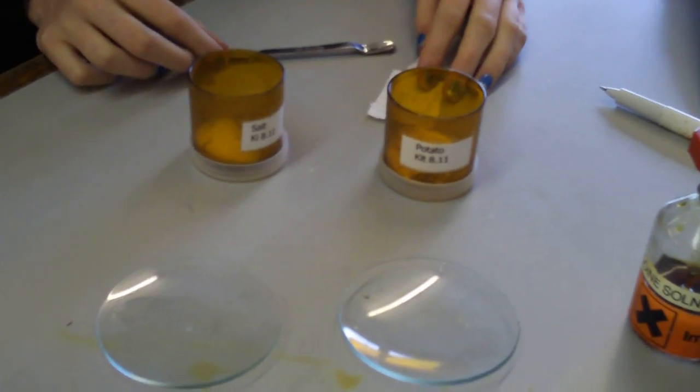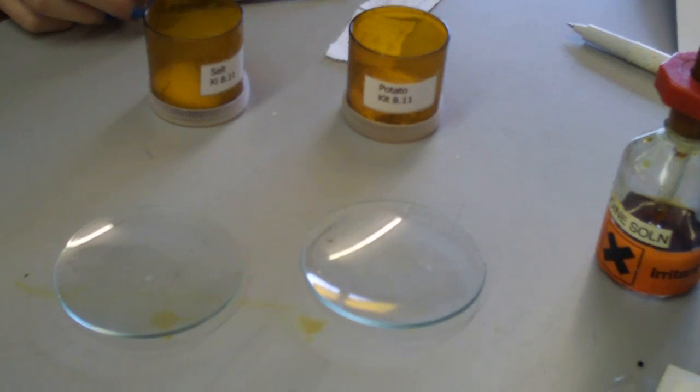Hi, I'm Rachel. Today we're doing an experiment to test for starch in some food.